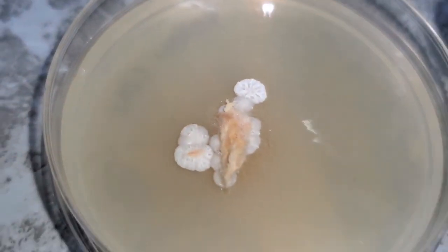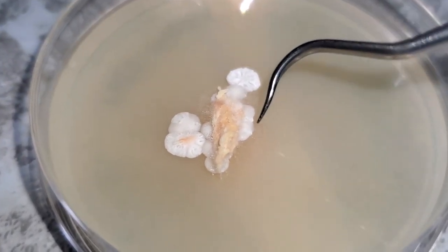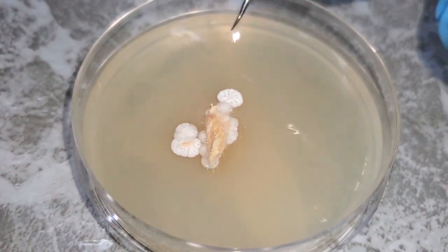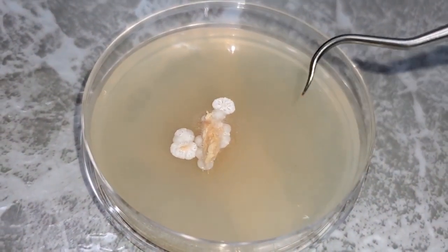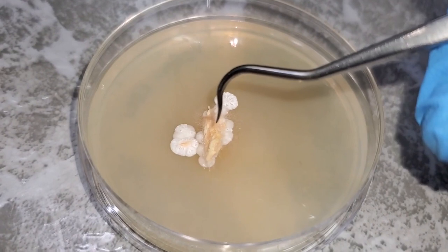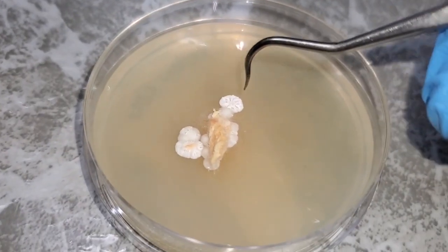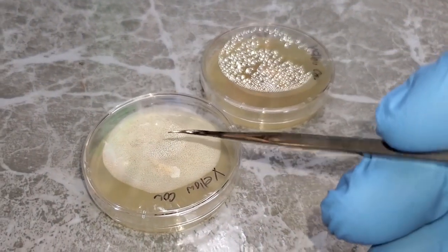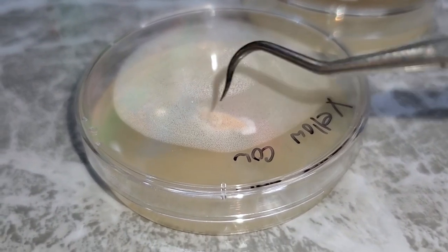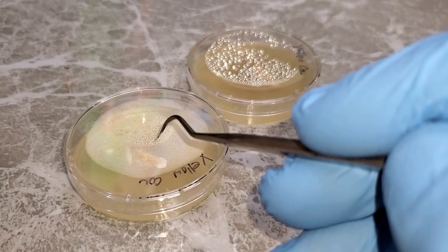But unfortunately, I guess we'll address the elephant in the room, or the elephant in the petri dish here. There are also these areas right here of severe contamination. Seeing as everything else around the petri dish is completely devoid of anything, there's no bacterial growth, no mycelial growth from molds, no yeast colonies, that leads us to believe that this mushroom tissue sample itself was contaminated with whatever this is that's growing on here. So let me put this underneath my little microscope, and we'll talk about this a little more so that you can see a little better. And then I'll show you how to salvage a sample like the one over here, which is contaminated but not quite as bad, for possibly isolating the tissue sample and the mushroom culture from that contamination.